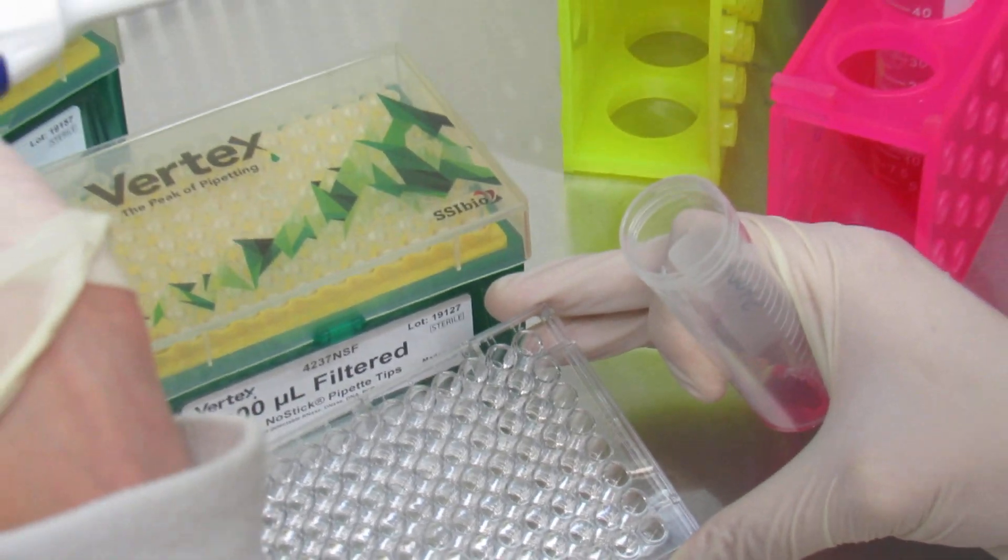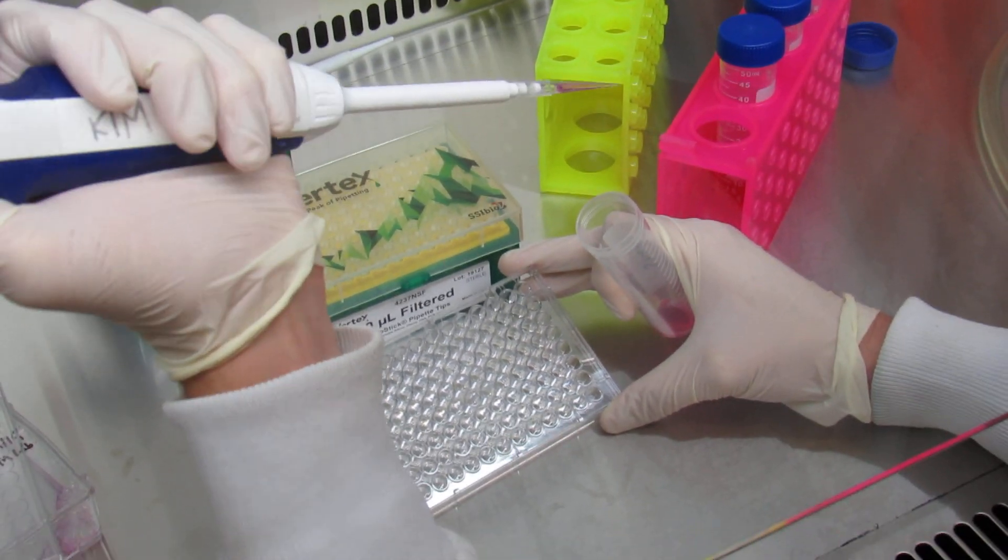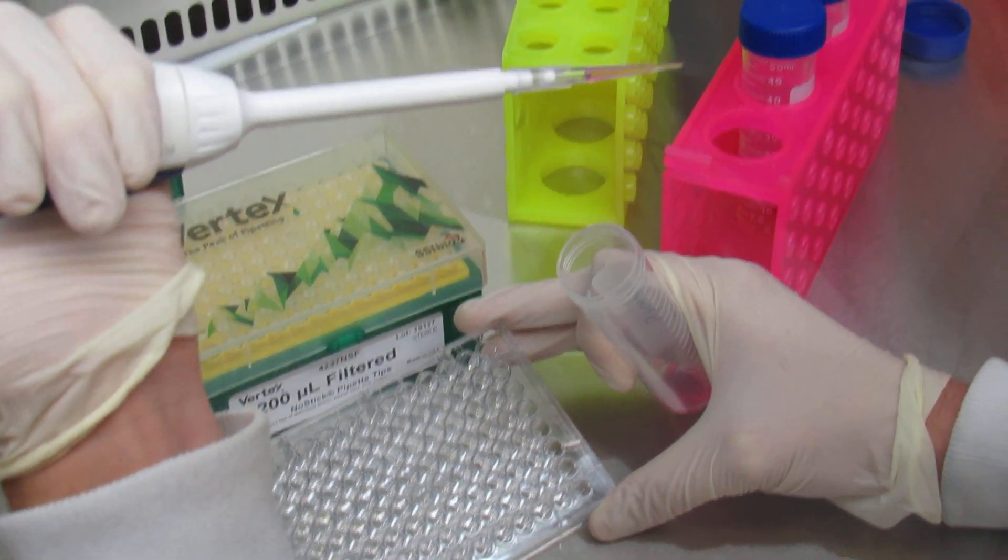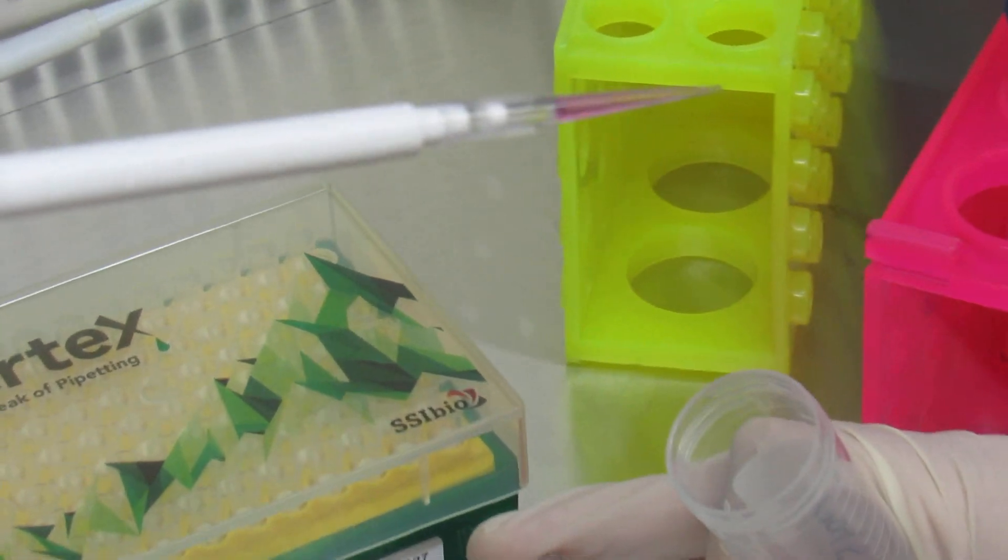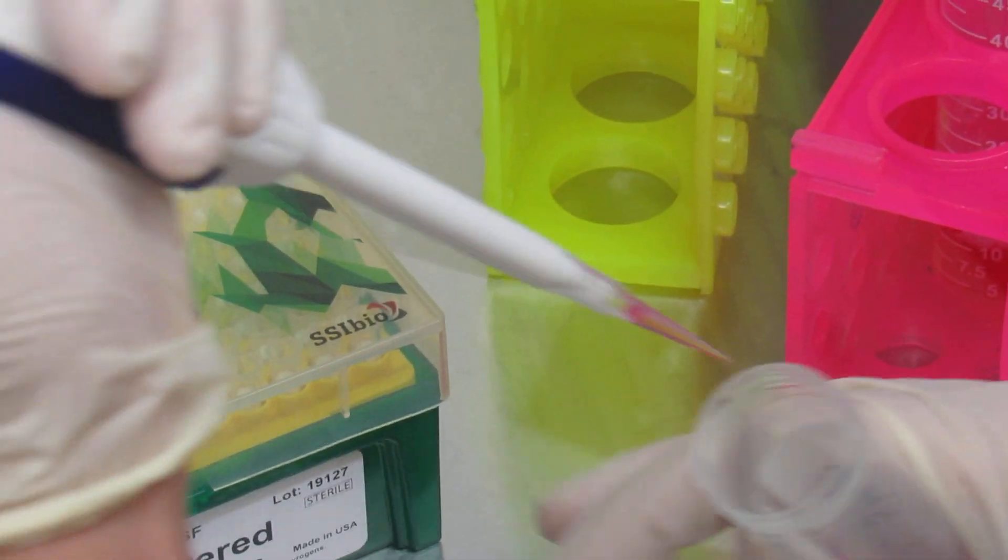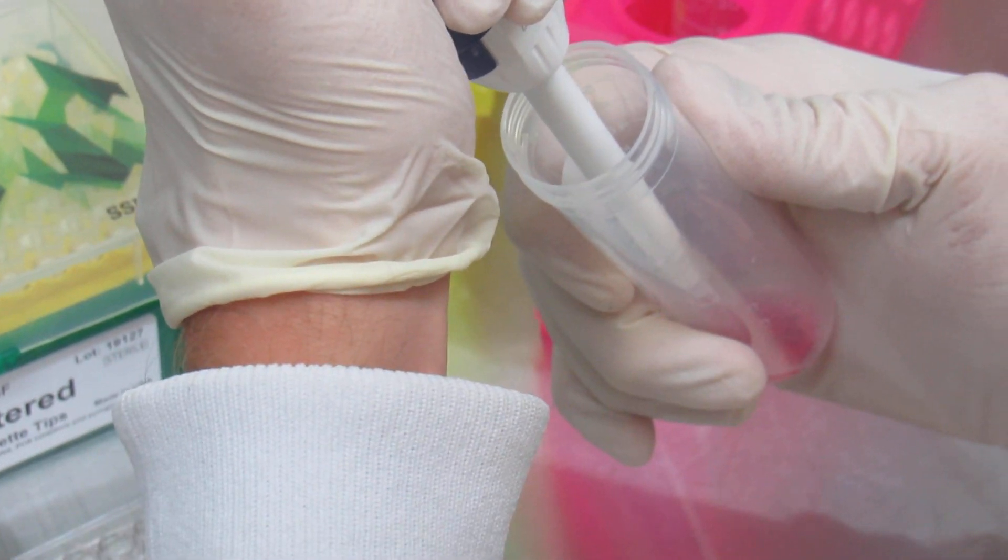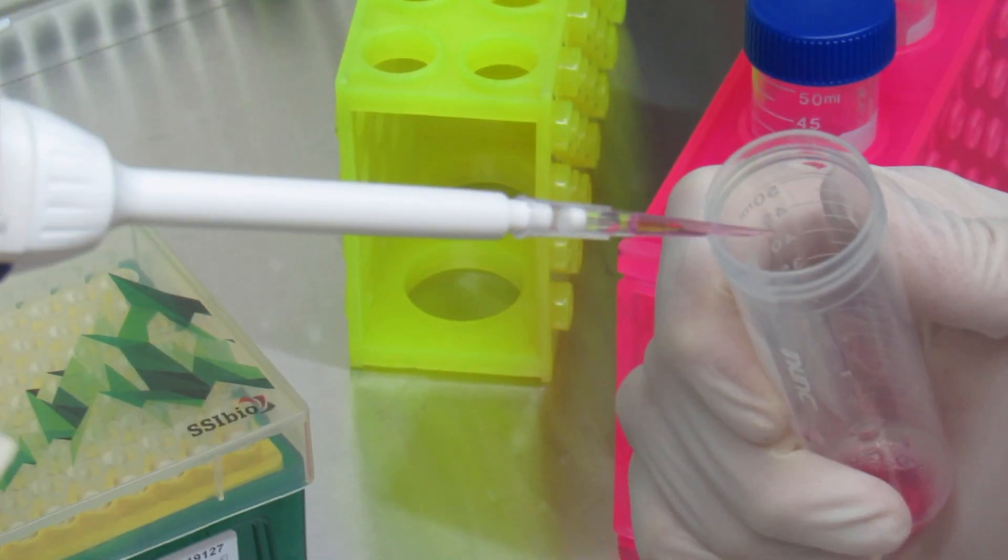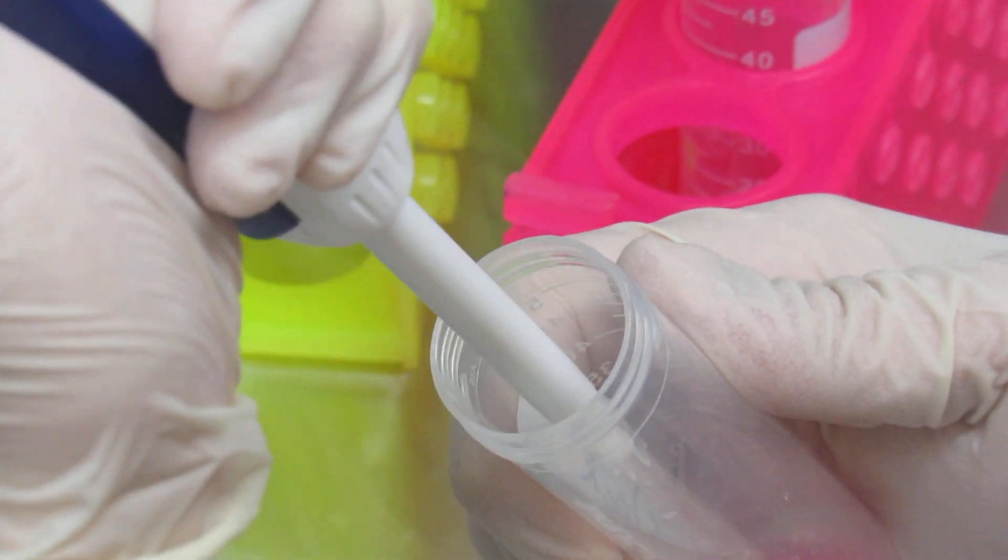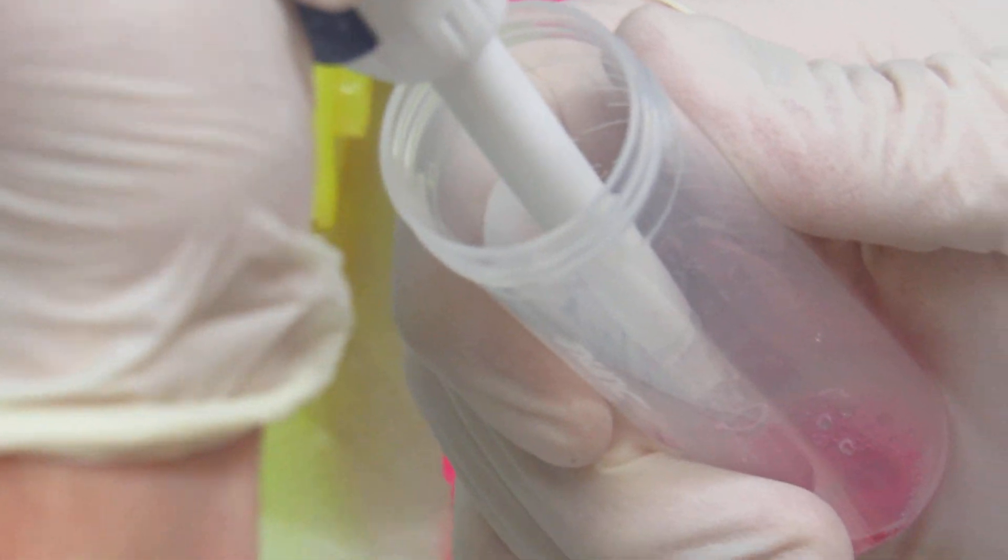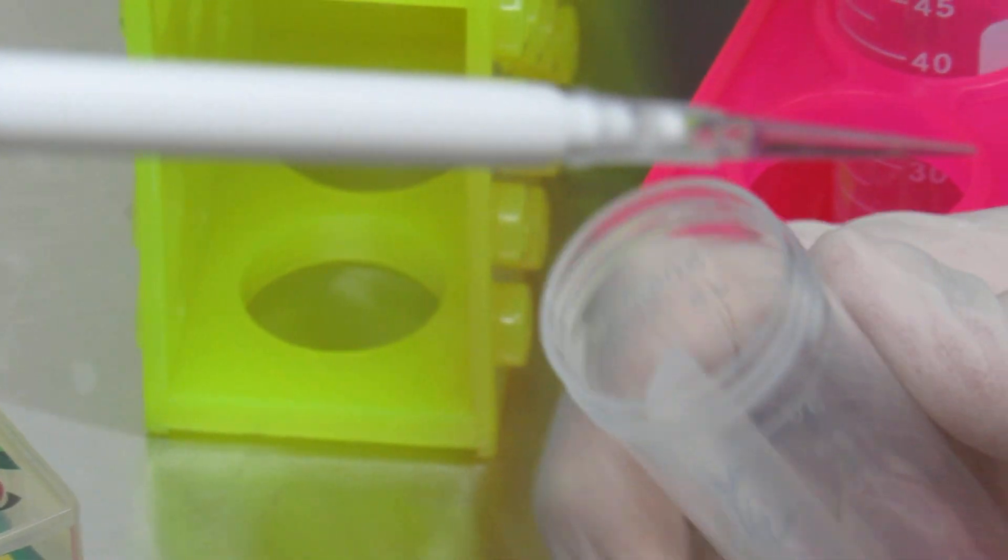When pipetting out, ensure that you look into your tip that you don't have any bubbles noticeable. As you can see, or maybe not see in this camera, I have a tiny bubble so I will go ahead and expel my contents to try coming up with a sample without bubbles in it. It's still there. Okay, that's good.